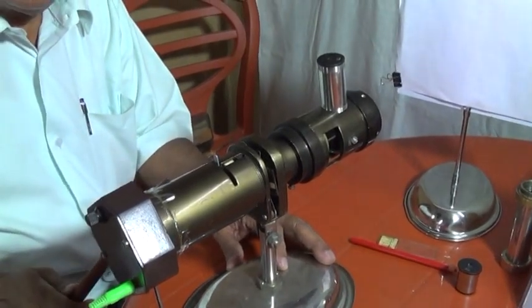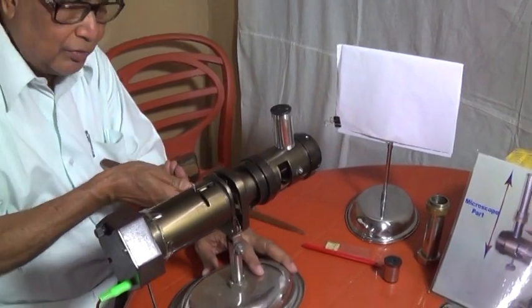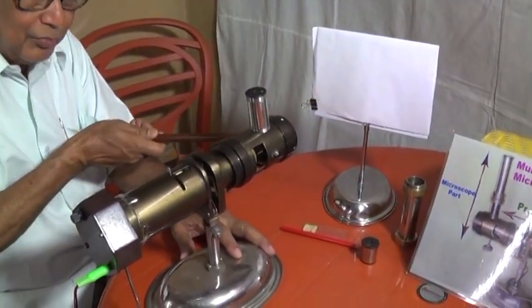We are getting the size of the image is 10 cm at 1 feet distance from the screen and projector.